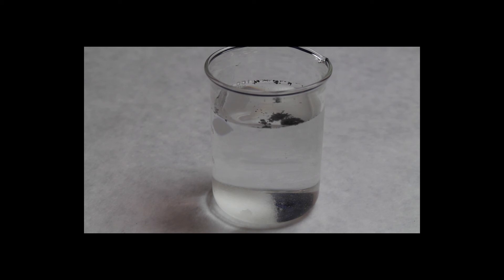The graphite still remains on top of the water, which indicates that graphite has different polarity and different intermolecular forces than water.